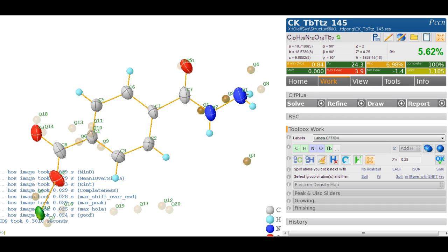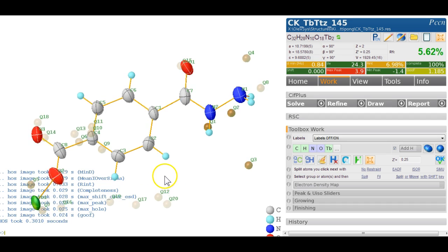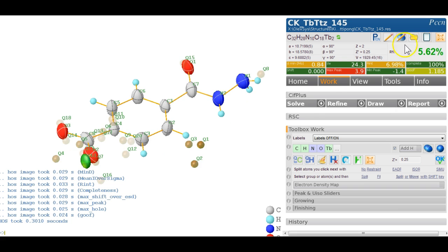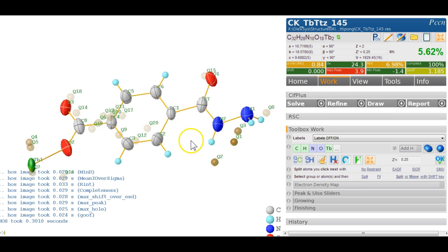Right, let's have a look at what's going on here. I just refined this and we got some Q peaks 1, 2, and 3, 3.9. That's fairly strong. Let's combine them all together like this. So what could that be?